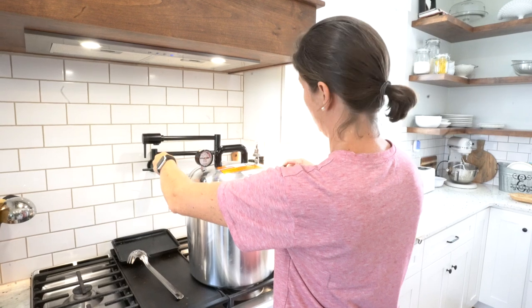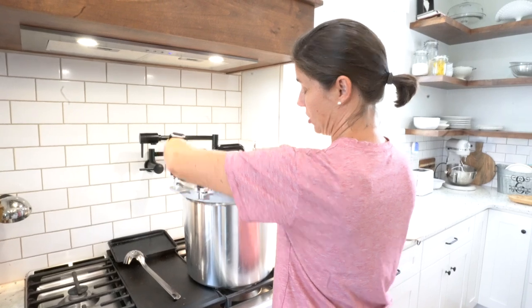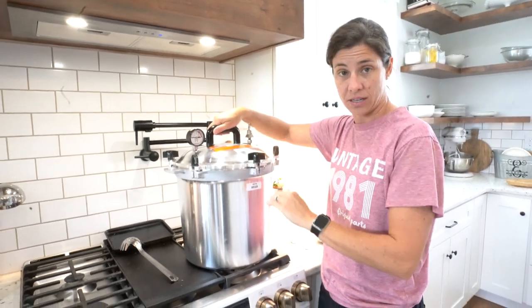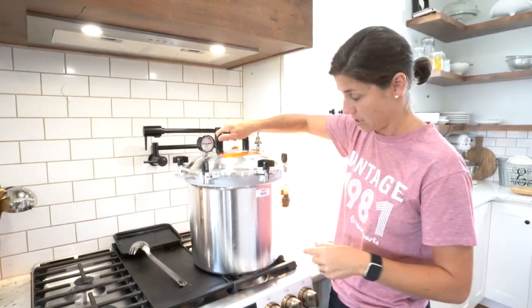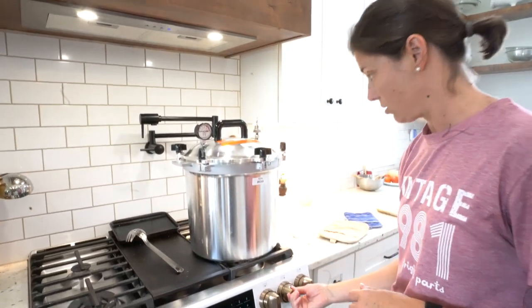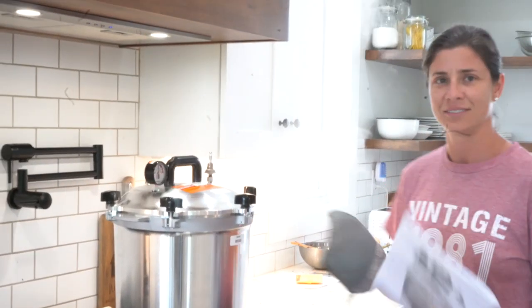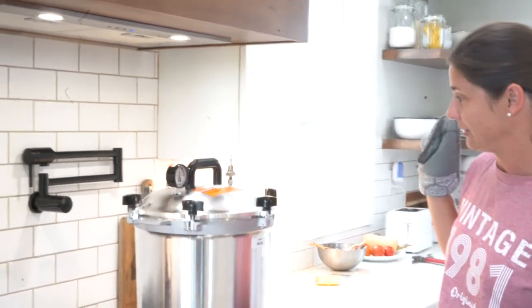I released the steam and pressure, let it cool, opened it up, cleaned the edge, and reapplied the lubricant. I also added more distilled water because some had been used up by the steam. I added back up to the water line before starting again to make sure we had enough. We've now reached pressure and are releasing for three to five minutes.